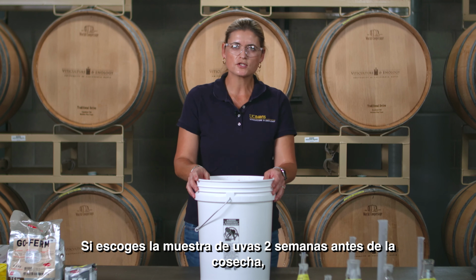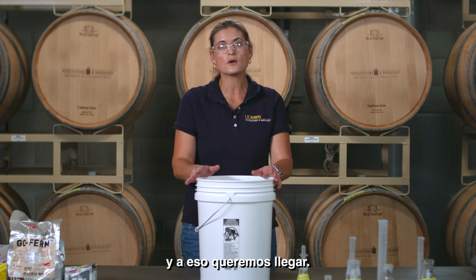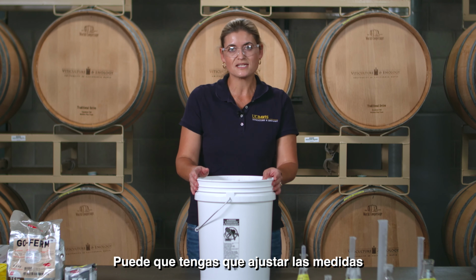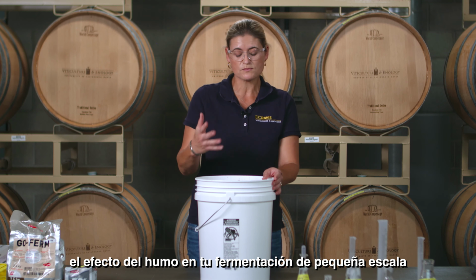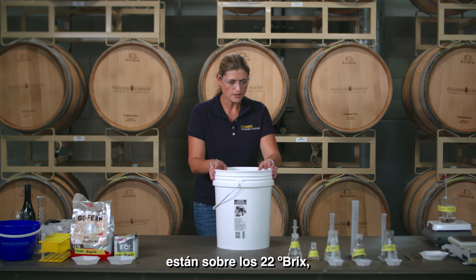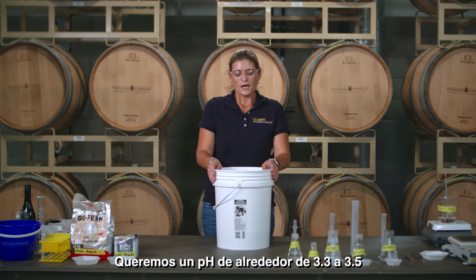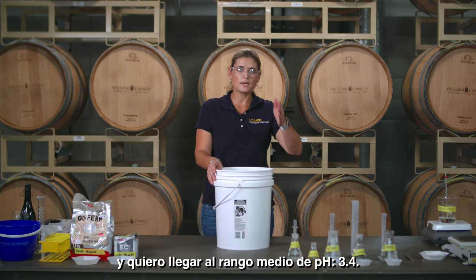If you picked your grape sample about 2 weeks prior to harvest, your brix of your grape are probably above 22 brix, and that is what we're aiming for. However, if you had to pick your grape sample much earlier, then you may possibly need to adjust for the acidity, because the acidity can make it very difficult to evaluate potential smoke taint in your small-scale ferments. So if you had your grapes above 22 brix, you may have to adjust the pH. We're aiming for a pH of around 3.3 to 3.5. My grapes have a pH of 3.6, and I would like to aim for the mid-range, pH of 3.4.